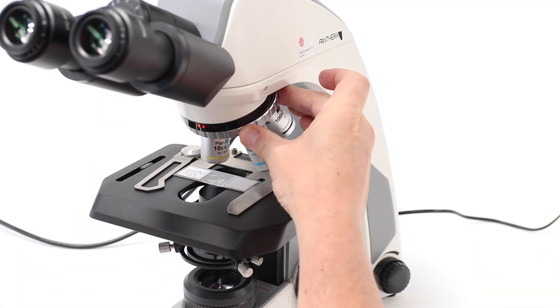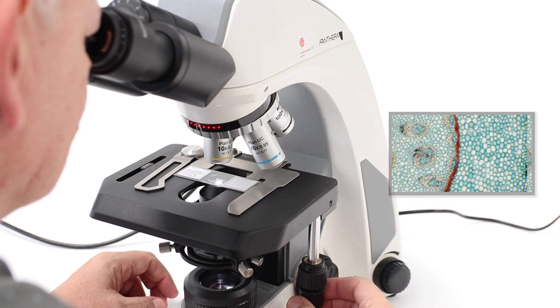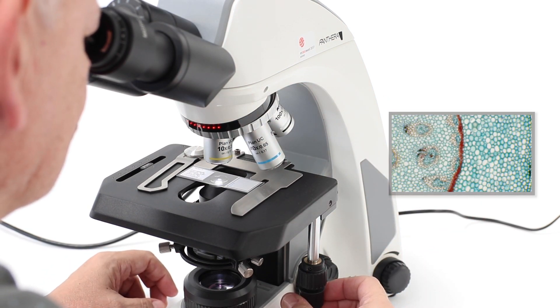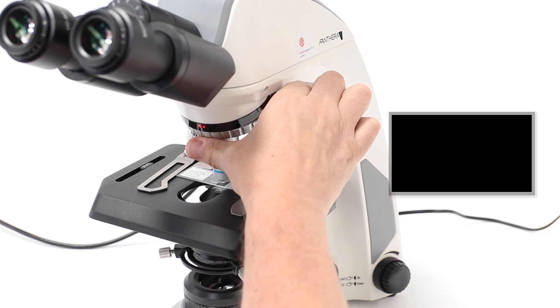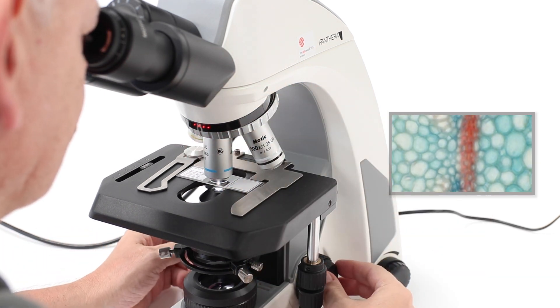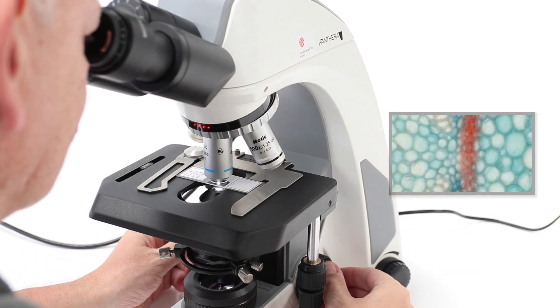Start by bringing the image into view using a low magnification objective, like the 10x. Then, select the 40x objective and while looking through the eyepieces, focus your sample using the microscope's focusing knobs.